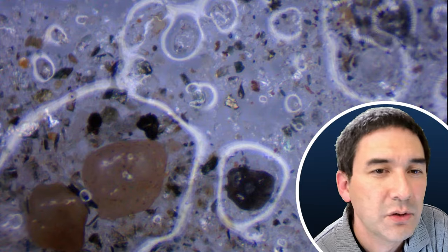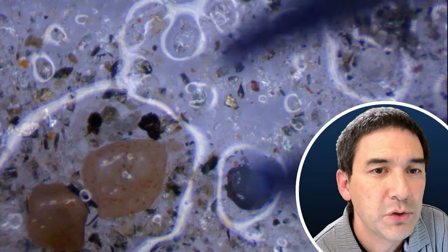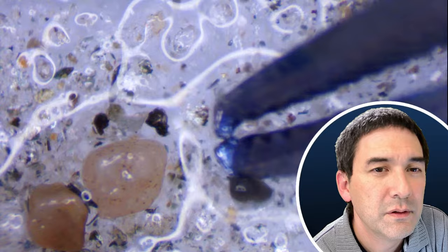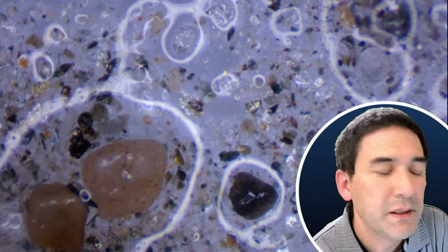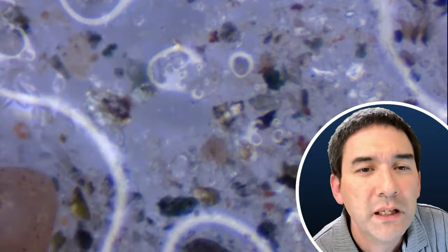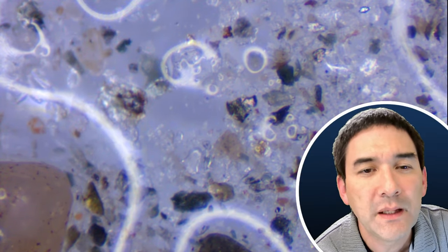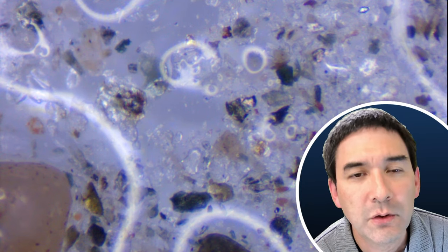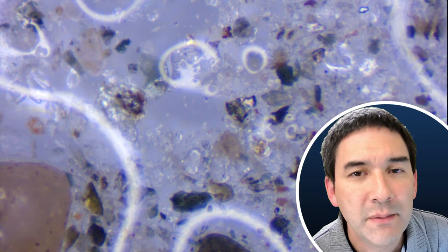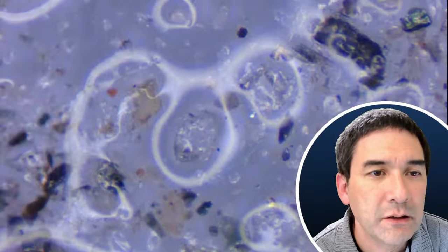When you press against it, it will scatter and fragment — it will not deform. Picking it up is a little difficult because the particles are quite small. But by zooming in further, you can actually see that the edges are quite sharp — that's a big difference from gold. Gold is much more round and the pyrite fragments scatter when you press against them.